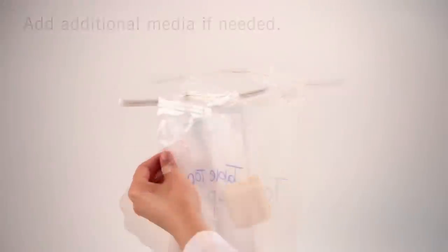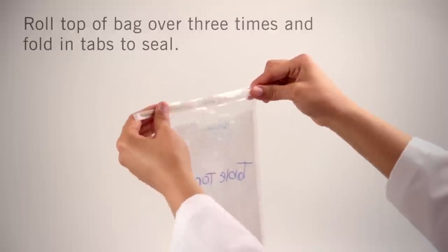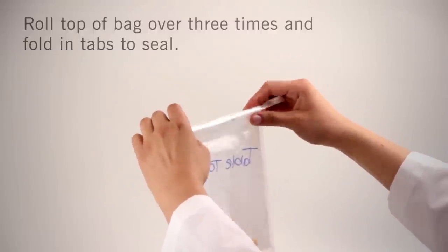If you are sending sample to a laboratory, roll the bag over three times and fold in the wire tabs to secure the bag closed.